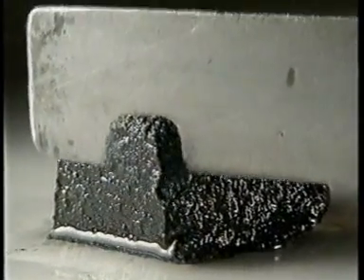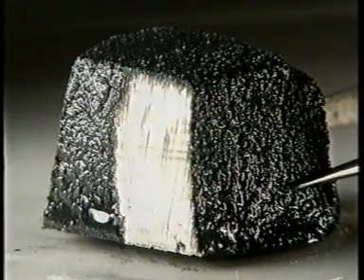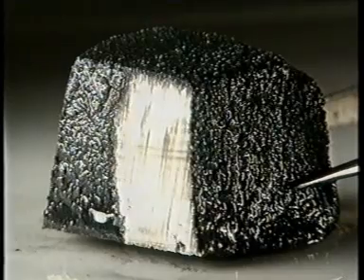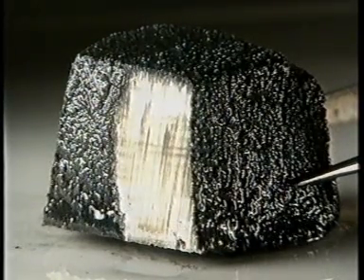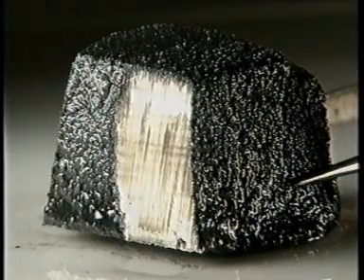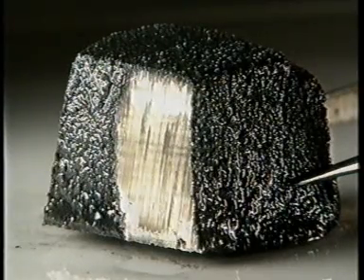Lithium is so soft it can be cut with a knife. You can see how shiny the freshly cut surface is, but leave it exposed to the air for a few seconds and it quickly begins to tarnish. It's reacting with the air.